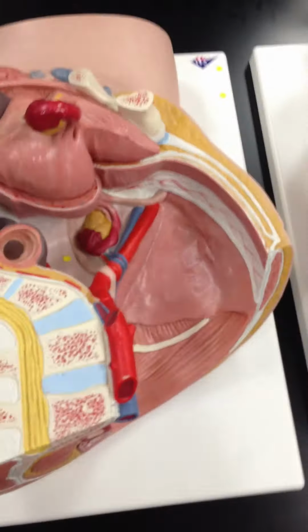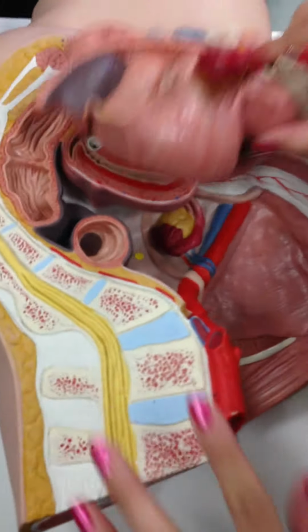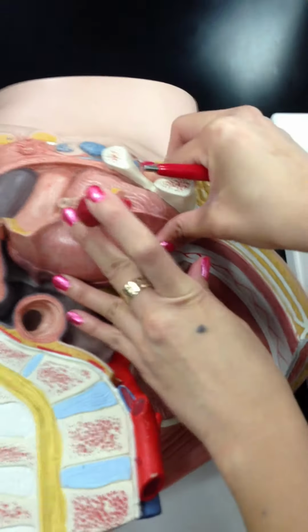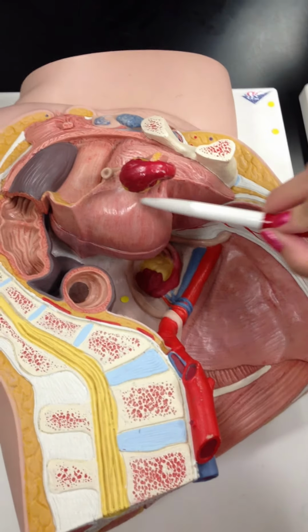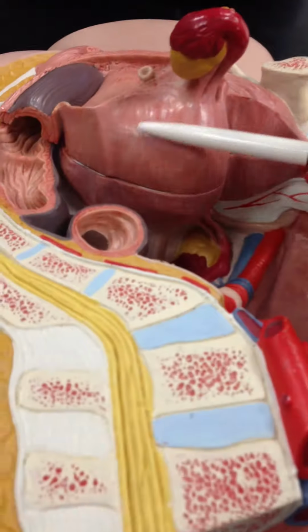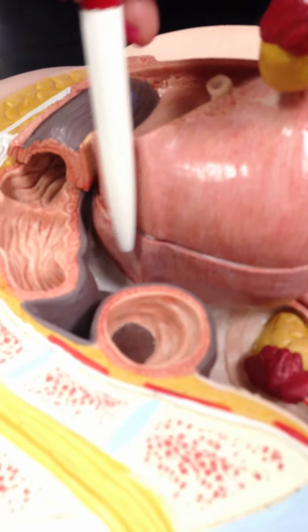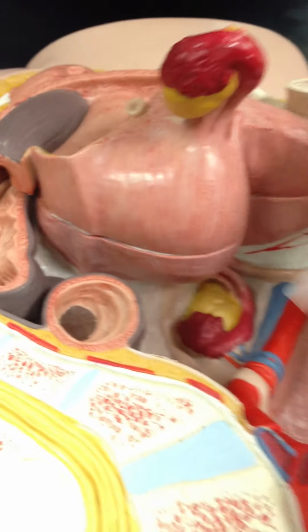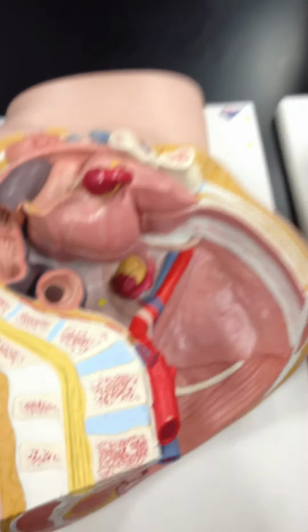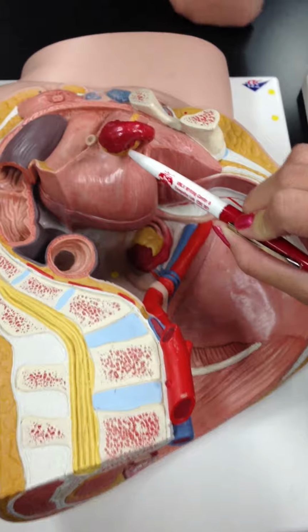Okay. So then for females, now we have a lot more. Alright, from the outside, this is the uterus here. And then down below it, below this ridge, we have the cervix. And you can see it a lot better when we open it, but we'll open it in just a little bit. Okay, so surrounding the uterus, we have the ovaries.